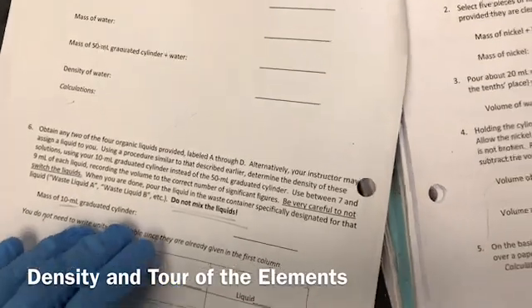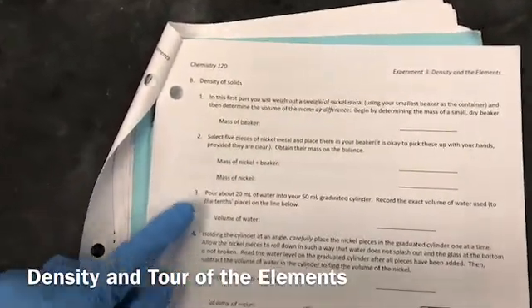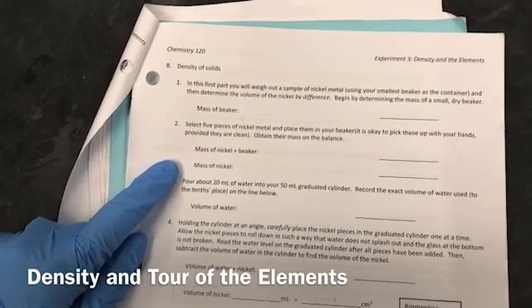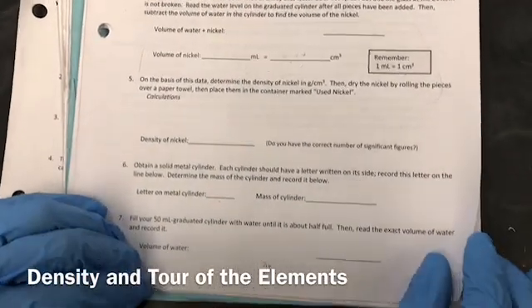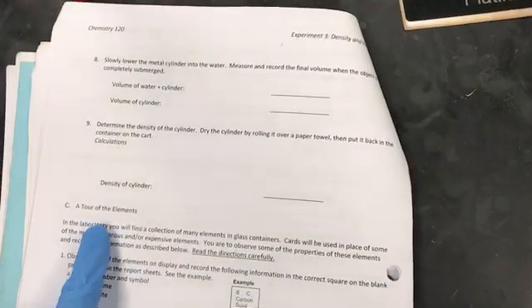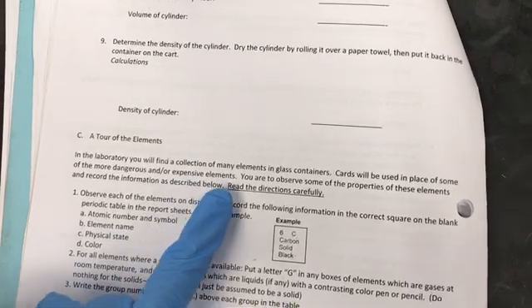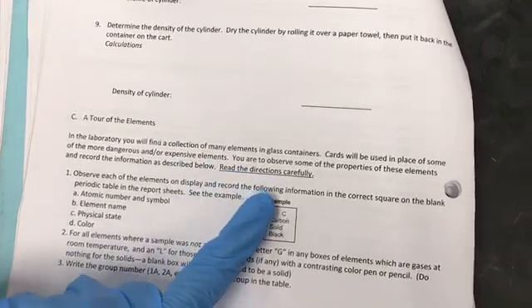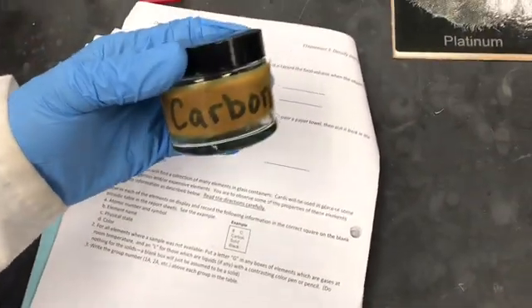And then we're going to record the density of solids. In the solids, we're going to record the density of nickel and the metal cylinder. The second part of the experiment is tour of elements. You will be seeing many different elements in the glass container or in the form of cards. Here is an example. This is carbon.